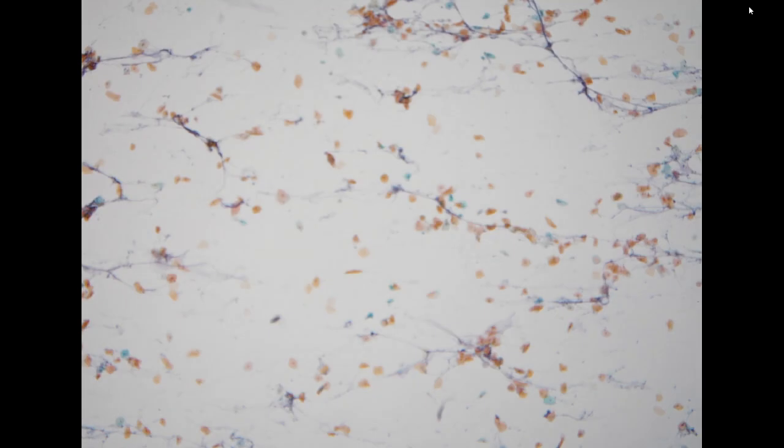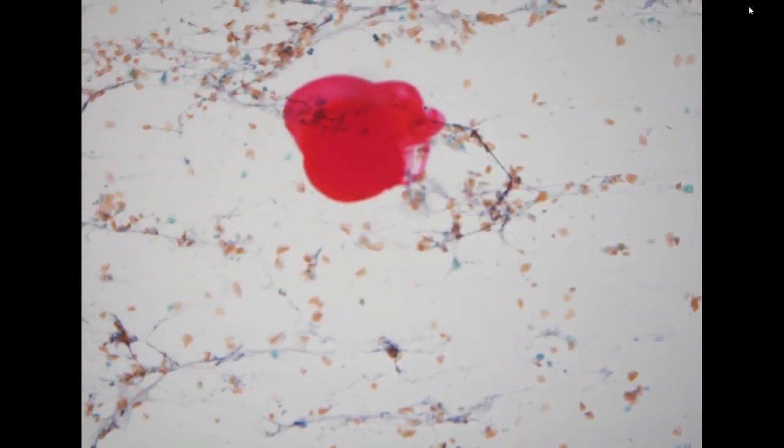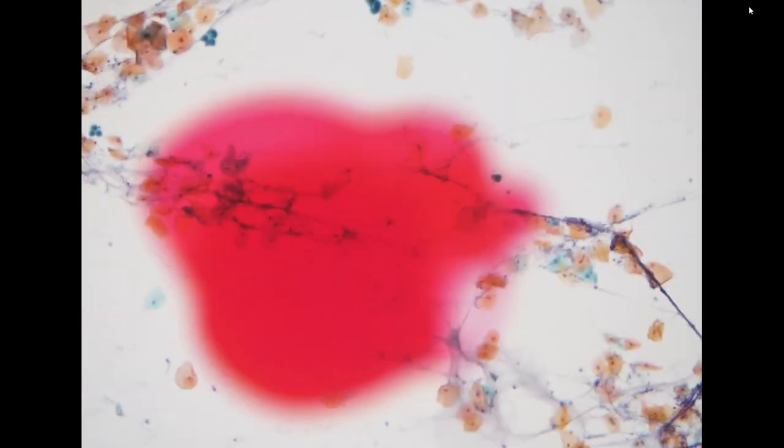The next specimen is a sputum. It is coming from Yuanshan, our branch hospital. The majority of sputum specimens in our hospital are examined at the chest department, not here in our pathology department.